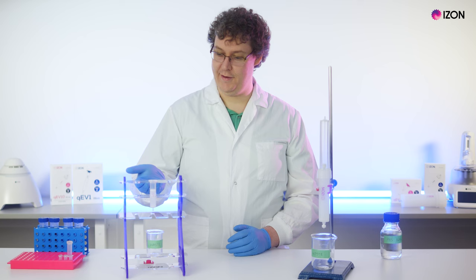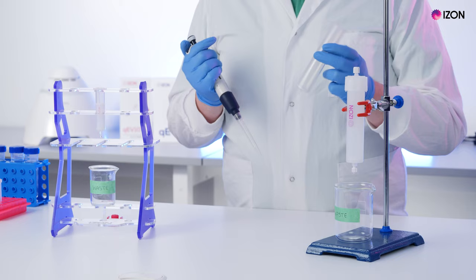The column should start to flow. The liquid will flow down as far as the upper frit, and then stop.